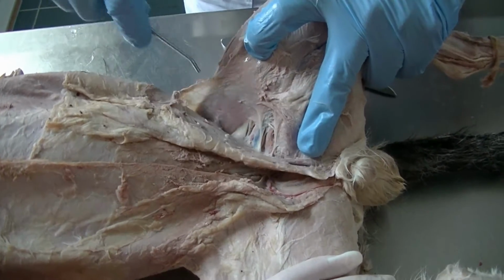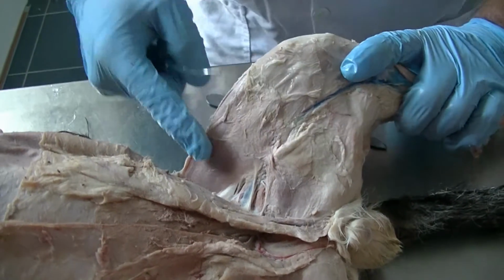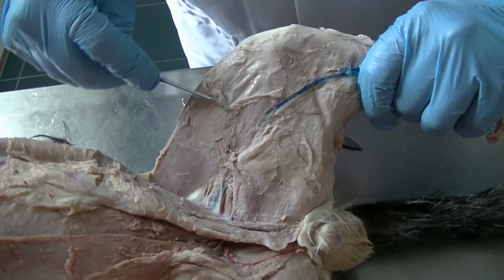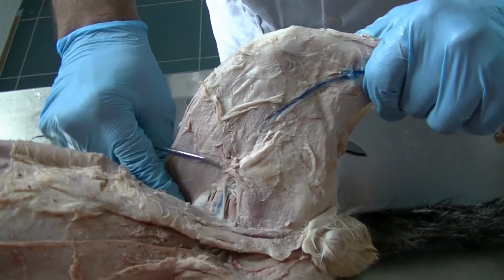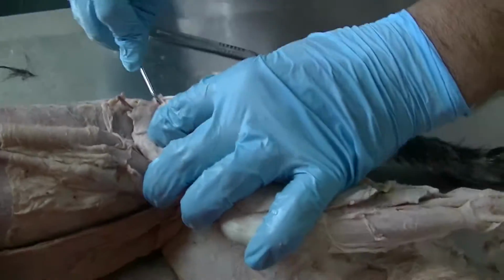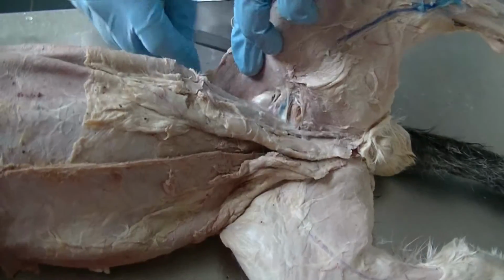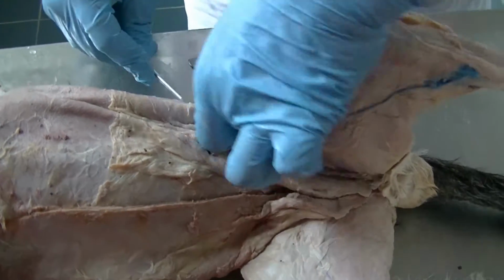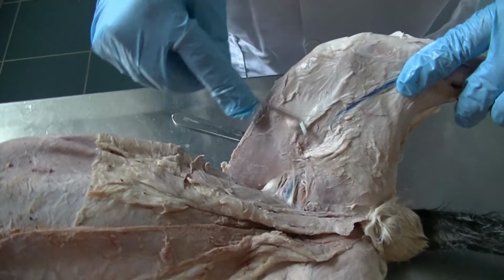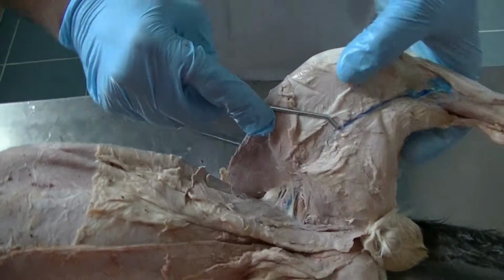One of the major differences we notice here on the medial side is the sartorius. Instead of having the cranial and caudal heads of the sartorius, the cat has only one head of the sartorius, and so that muscle would be seen extending further towards the tuber coxae, as well as part of that will merge into the iliopsoas muscle. So that is your sartorius, one single head. Okay.